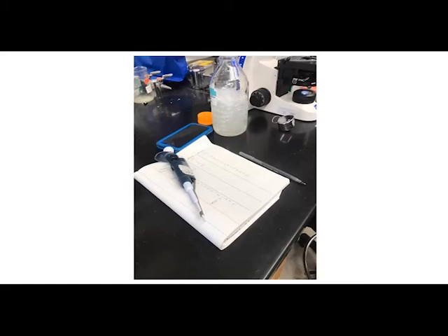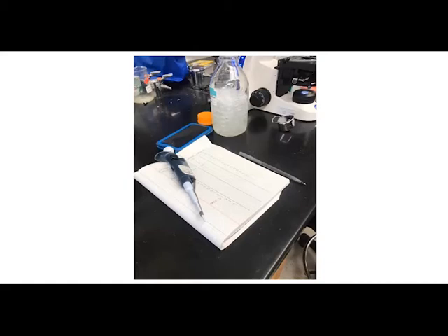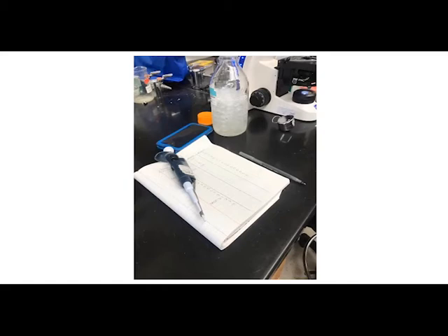In summary, we have scientists that go out and sample these hives, they mail the samples to us, we look at them for disease, record that data, and report it back to the beekeepers so they can decide how to manage their operation. We do make recommendations, but essentially it is up to the beekeeper what they want to do with this data.